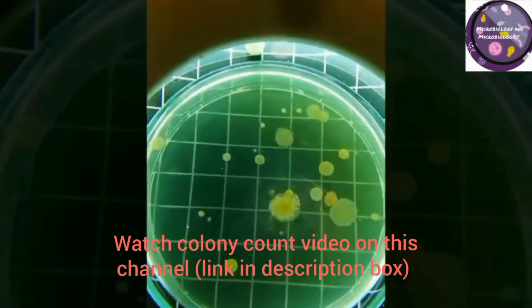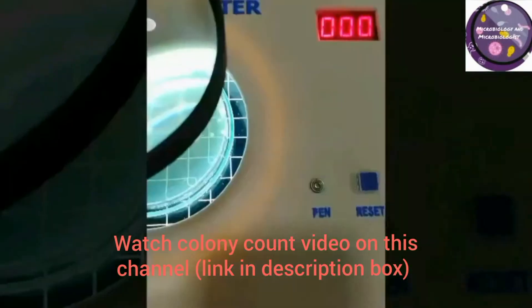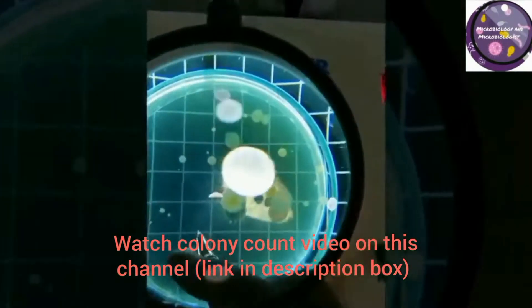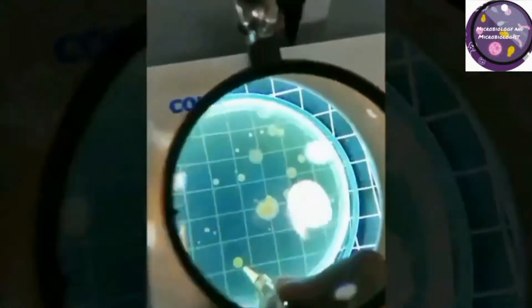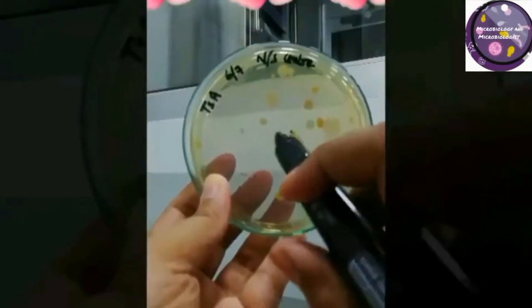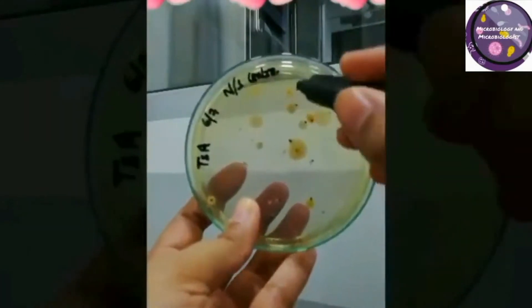A colony counter may not be the most important equipment in a microbiology lab, but it is useful and time-saving. When you have incubated your petri dishes with media nutrients, colonies grow on the media. For the ease of counting lots of colonies, we use colony counters. Manual counting can take a lot of time and effort, and you may lose count. With a colony counter, the number of colonies appears on the display, so there is less chance of missing the count.